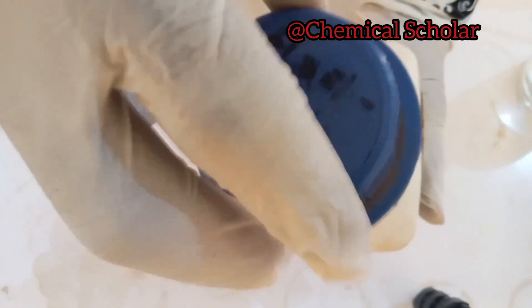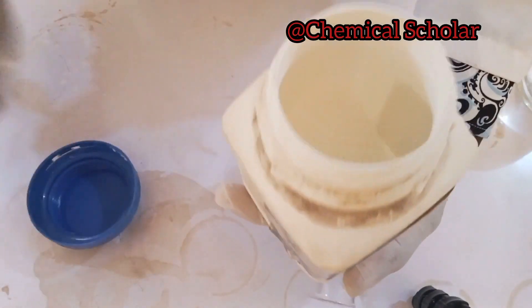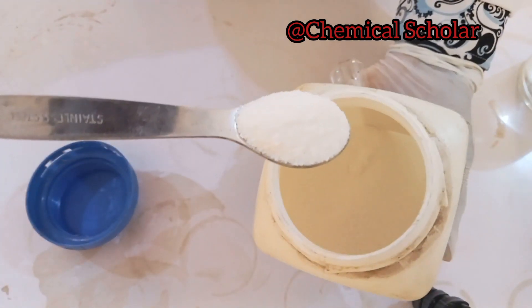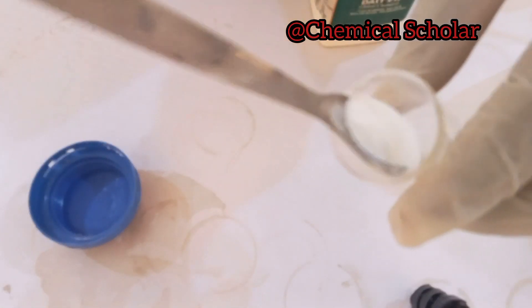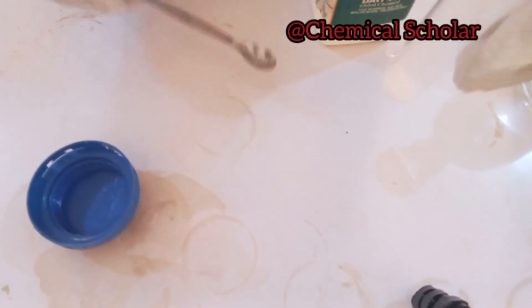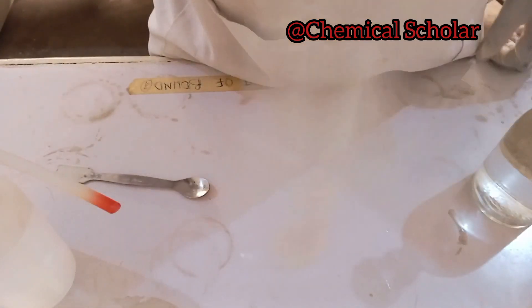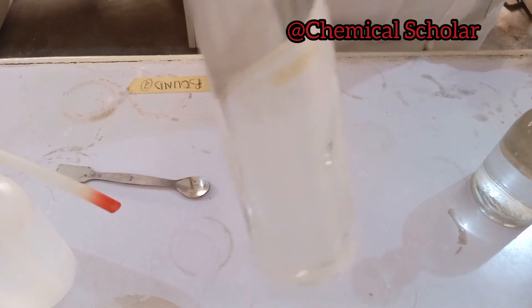We open the sodium carbonate salt — you can see that it is a white amorphous salt — and put it inside the boiling tube. You can see the salt inside the boiling tube. We then dissolve it in water using the wash bottle, pouring water inside and shaking it, then waiting a moment to allow the salt to dissolve.